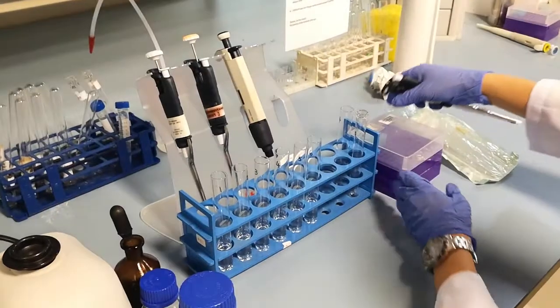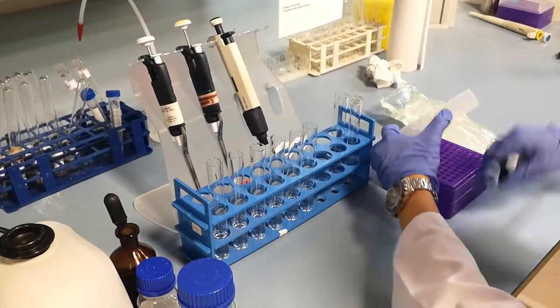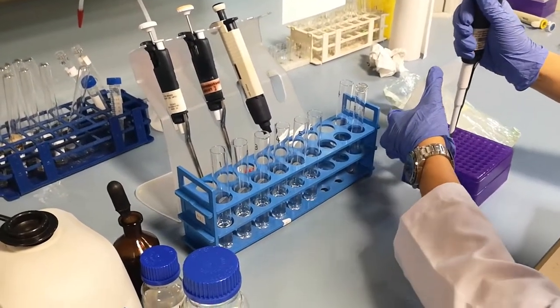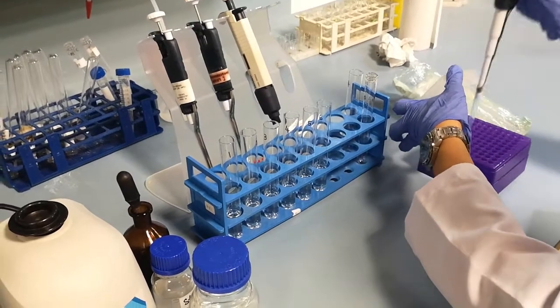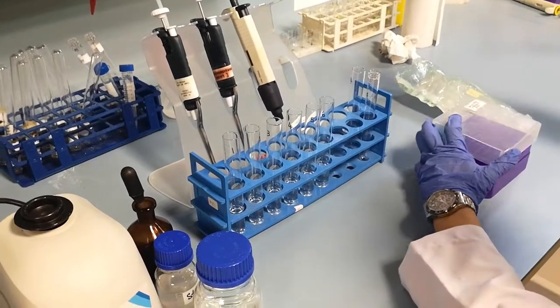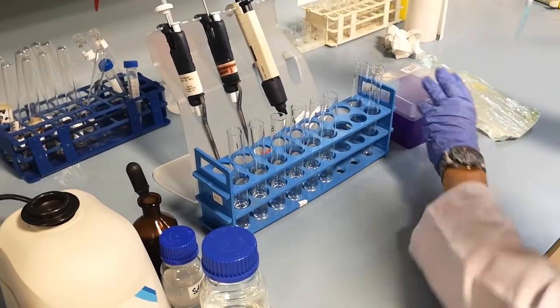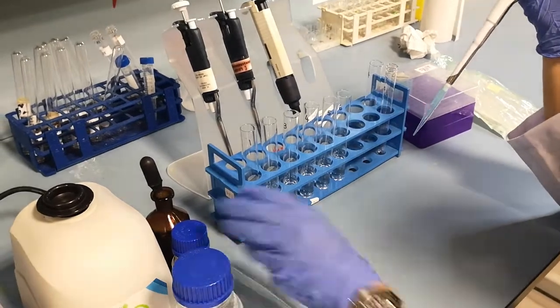Next, take 1 ml of starch solution that has been heated at 80 degrees Celsius for 5 minutes, and add it into the test tubes containing 9 ml of distilled water.